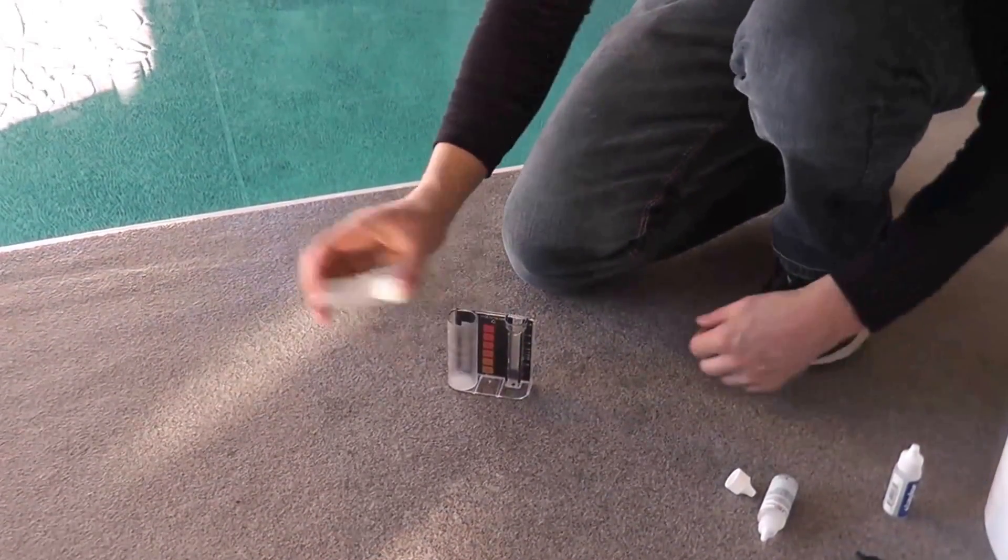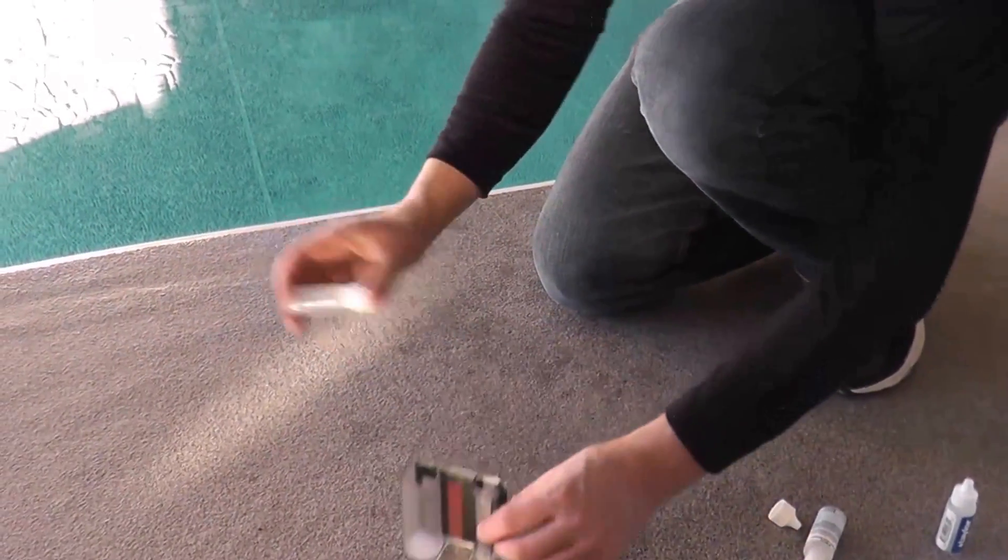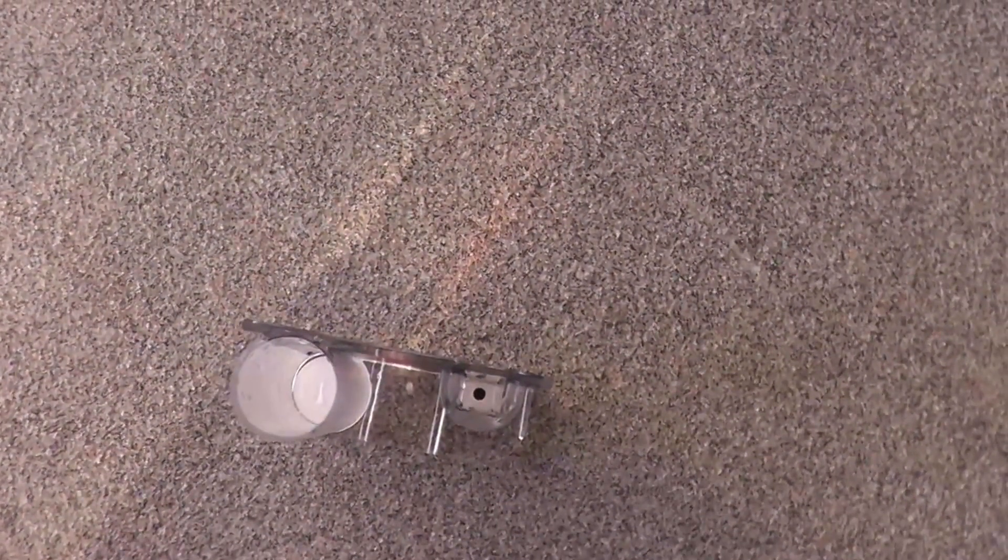The next step is we're going to add it into this tester here. And if you look down the tester, there's a black dot at the bottom. So we keep adding this water mixed with reagent until the black dot disappears.